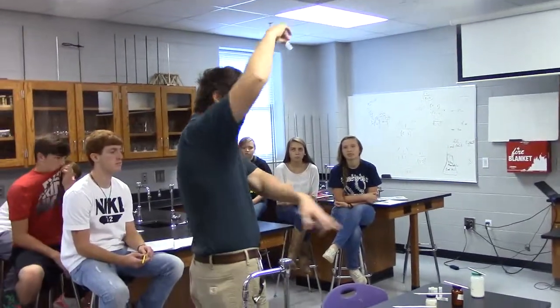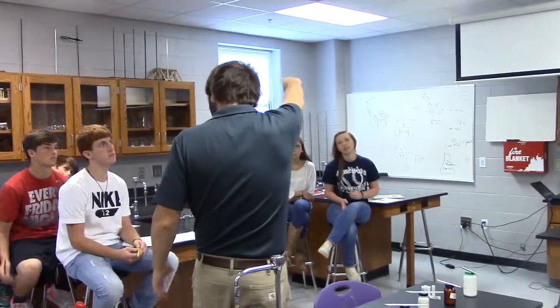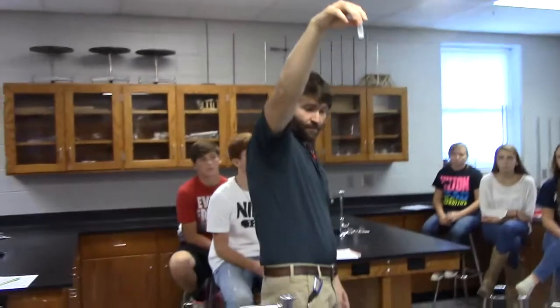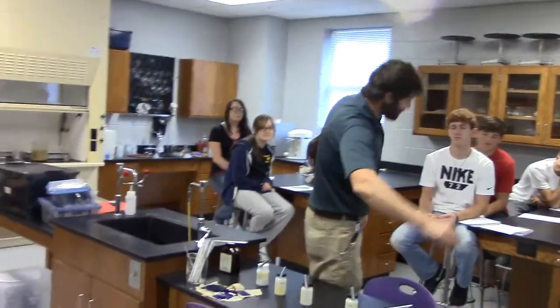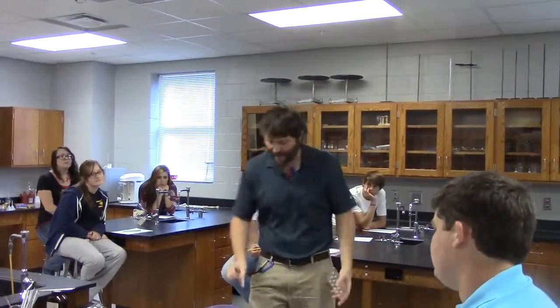Then after you've burned them and recorded the color that they give off, what are you going to do? Burn that. Burn this unknown. And what should you be able to do? Identify it based on the color. Based on the color. So this one should match one of these other 7 over here. So you should be able to identify it. Kind of easy in terms of making sense, ain't it? That's the whole idea of this flame test lab though.